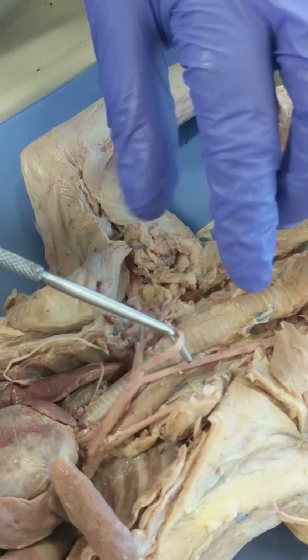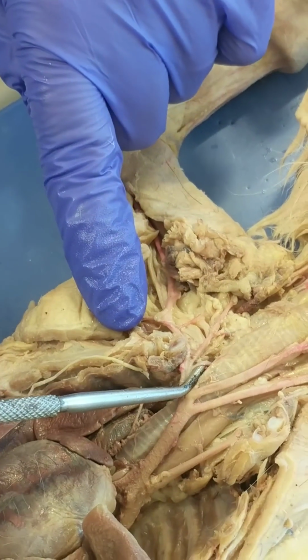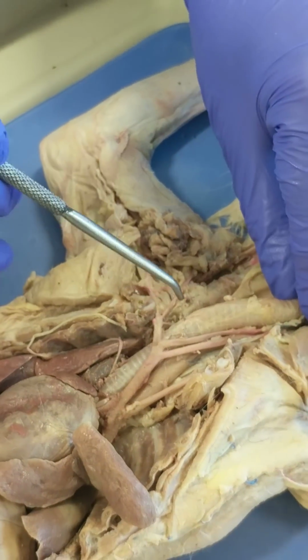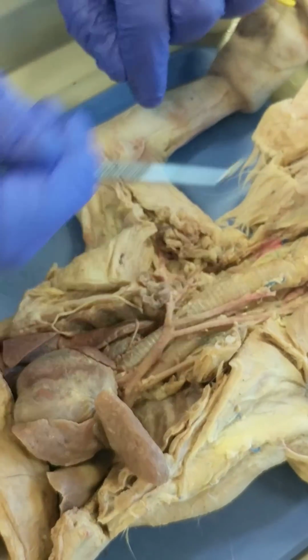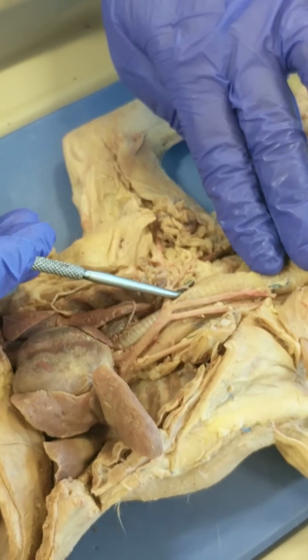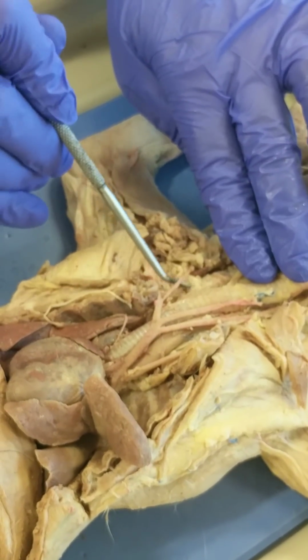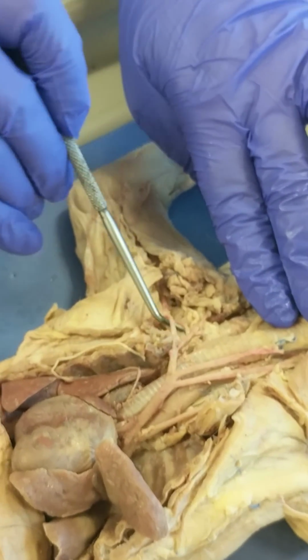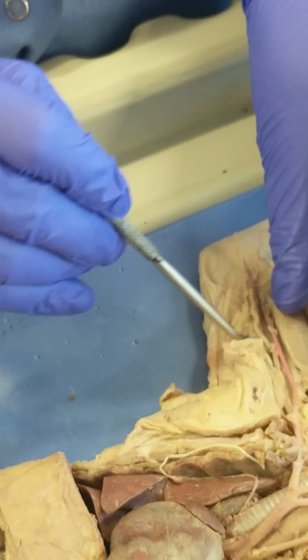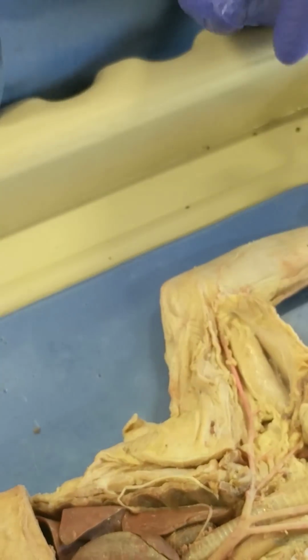And then the other little one here is called the vertebral artery, and it dives down into the cervical vertebrae and takes blood to the brain. So it looks insignificant, but it's very important. So here we have the right subclavian, thyrocervical, axillary, and then when you get out to the arm, we're going to go way out here. Now we're going to call it brachial artery here.